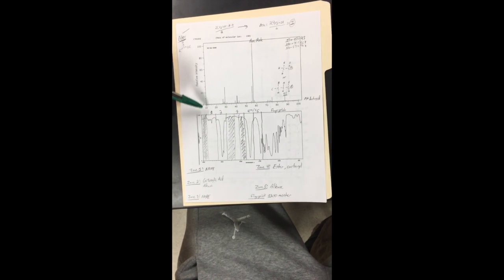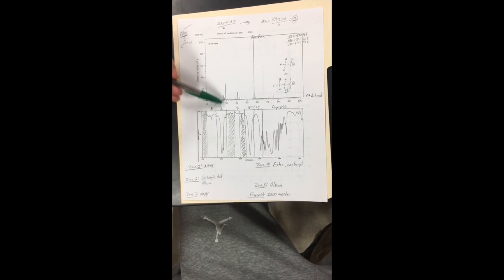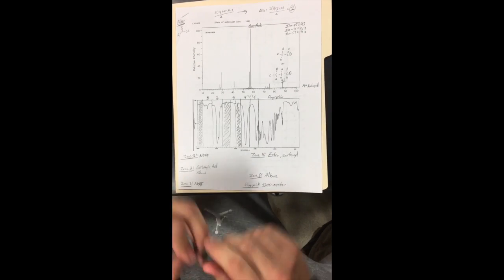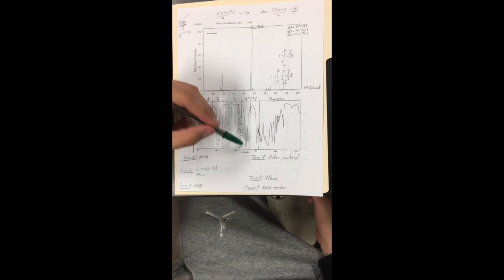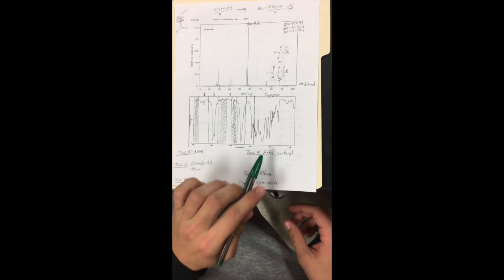So now we went to the IR region. It has 5 zones. Look at zone 1, there's nothing there. Zone 2 suggested a carboxylic acid or an alkane. We believed it to be an alkane. Zone 3, nothing, as you see, small line. Zone 4 went down very far, which suggested an ester or carbonyl. As we were told previously, we do have an ester in the group, so that's what we were going with.